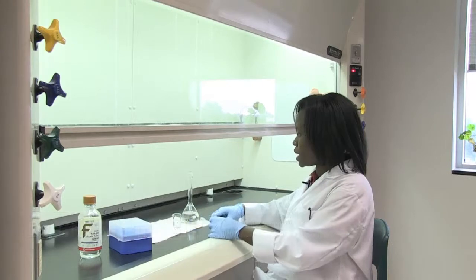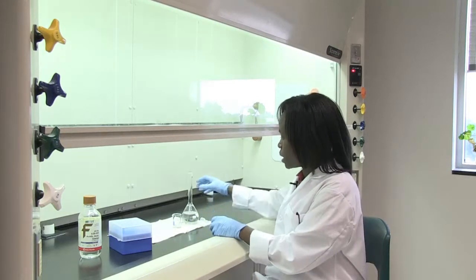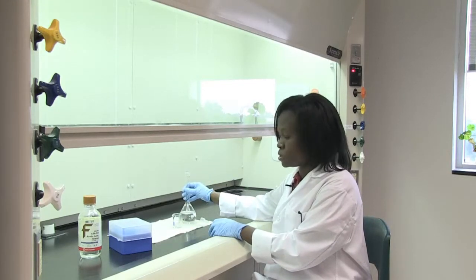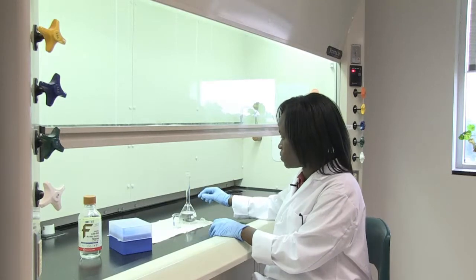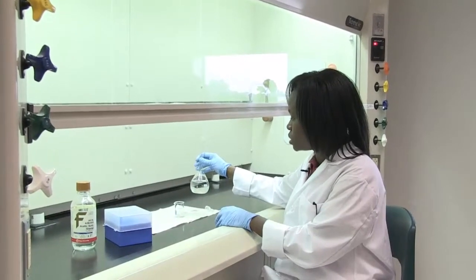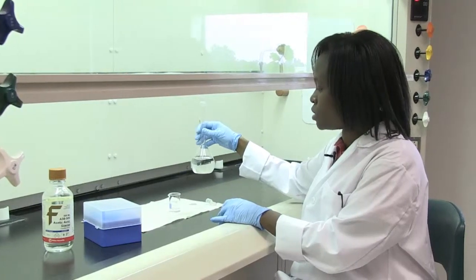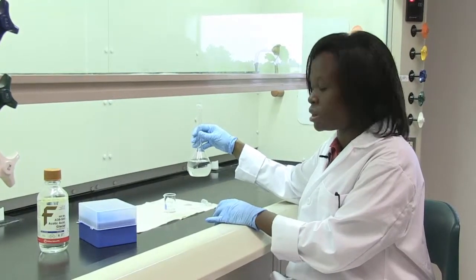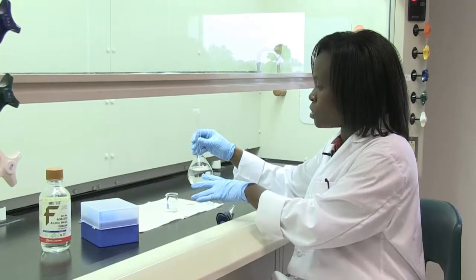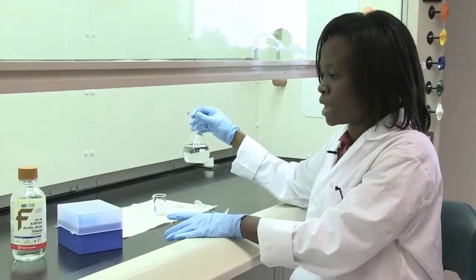I'm in the process of making up my acetate buffer in order to do my titrations. I have already added the sodium acetate — 2.1 grams of anhydrous sodium acetate into some water. I'm making this buffer in a volumetric flask. I've already weighed out my sodium acetate salt and placed it in a certain quantity of water. I don't fill up to the 250 mL mark yet because I have to add my acetic acid.